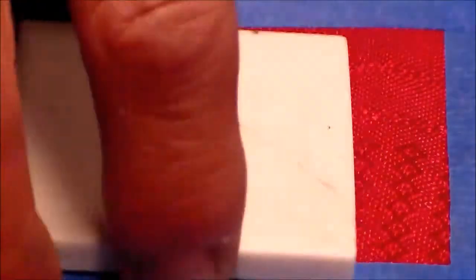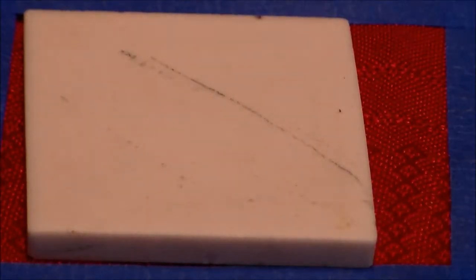We'll use a porcelain plate. This is a streak plate. Minerals, though they may, to our eye, vary in color, their streak will not vary at all. So minerals are always composed of the same elements, but sometimes another element can get kind of thrown in there, and it'll make the outward appearance of the mineral different, but the streak will always stay the same.